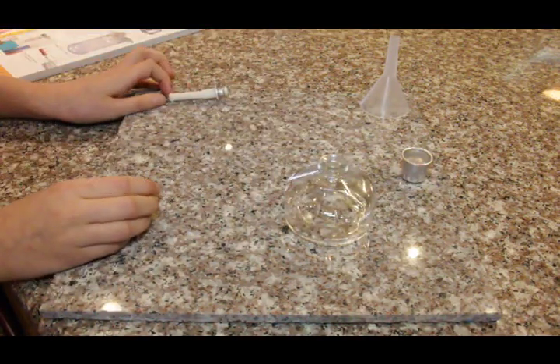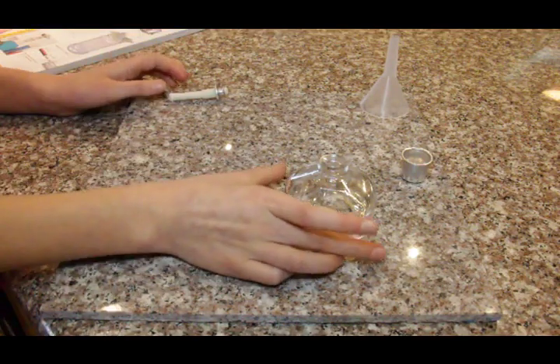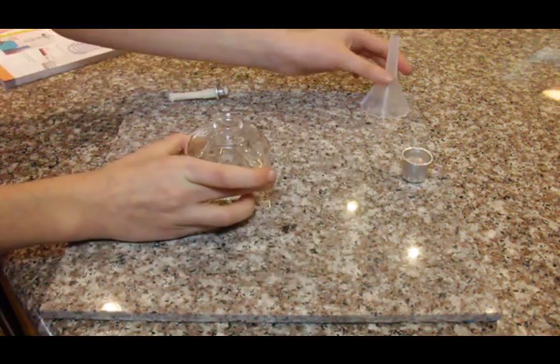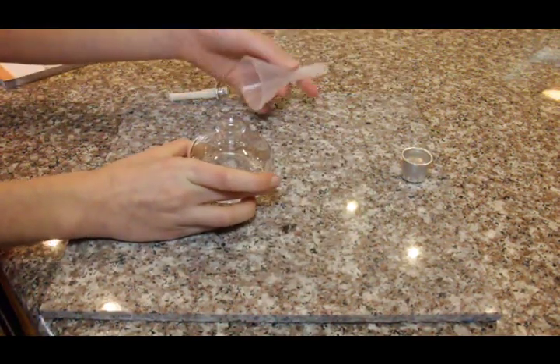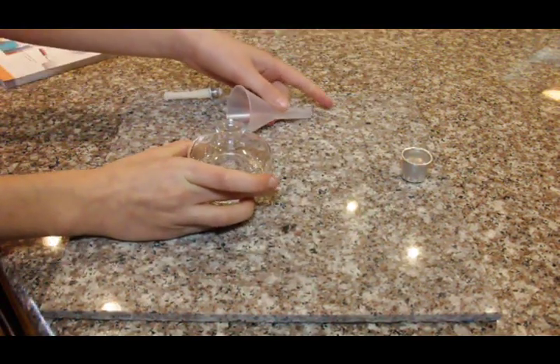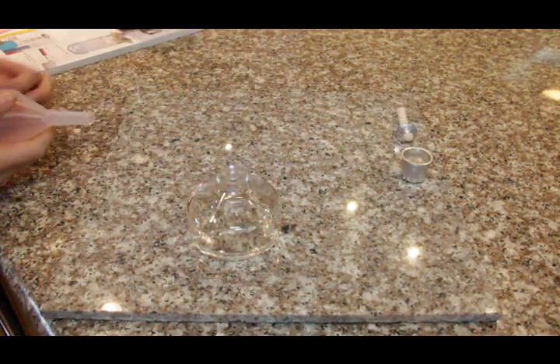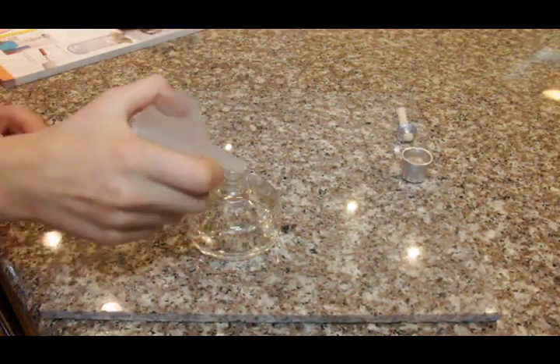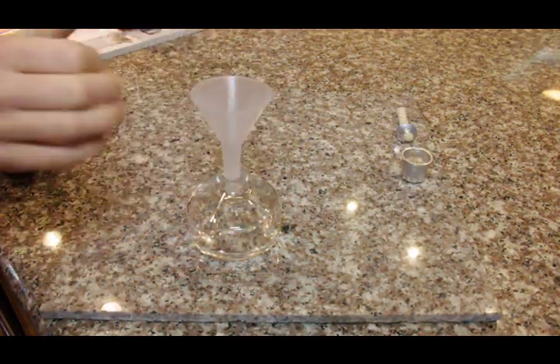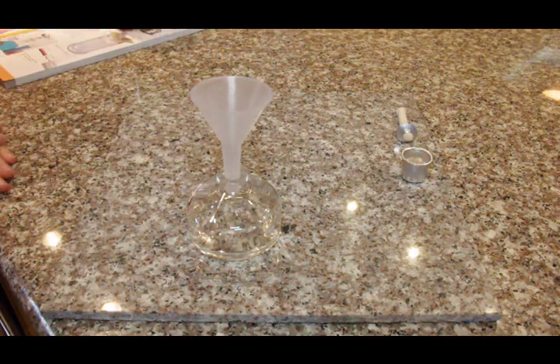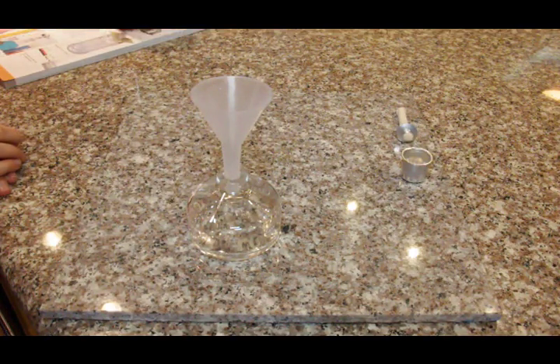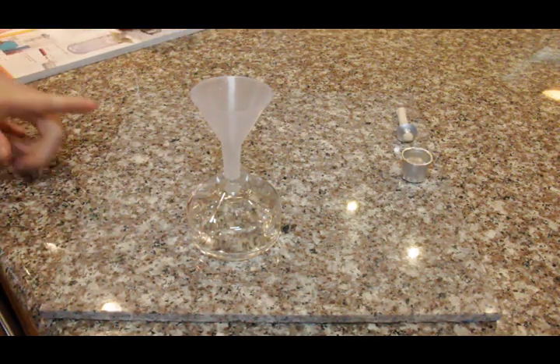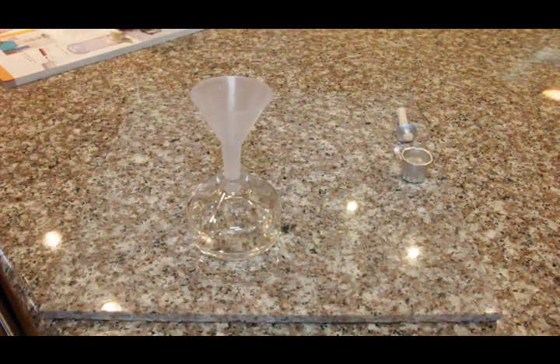For the next step, you will need your burner base and a funnel to allow air. You will put the funnel in like this. For the next part, you may need an adult assistant. You need to pour some denatured alcohol into the bottle.